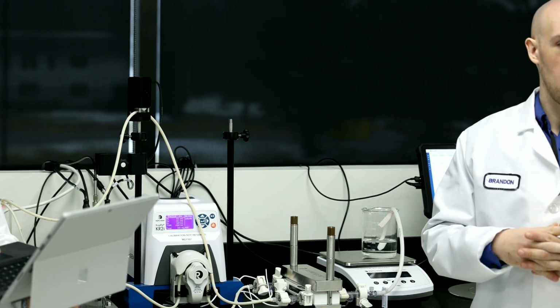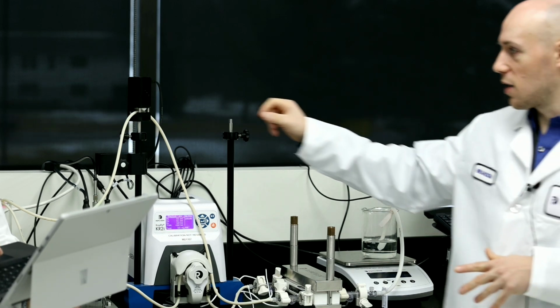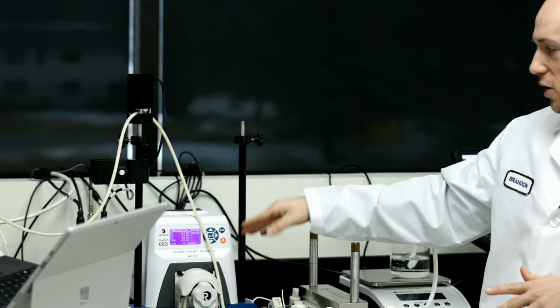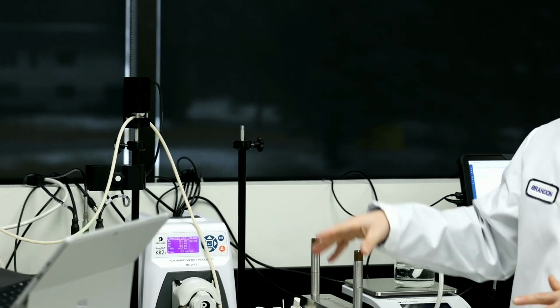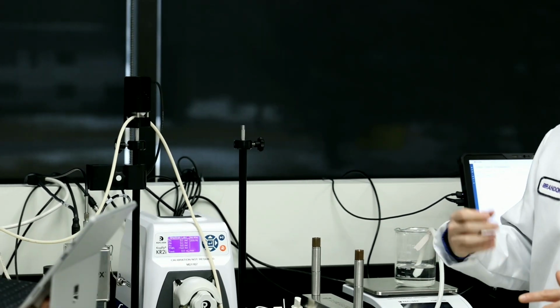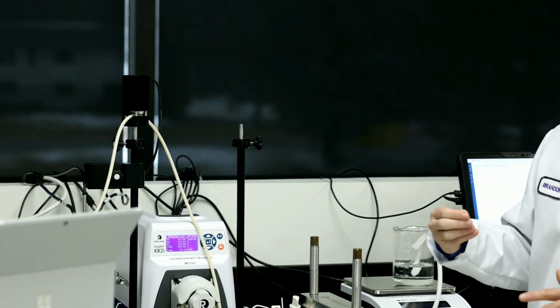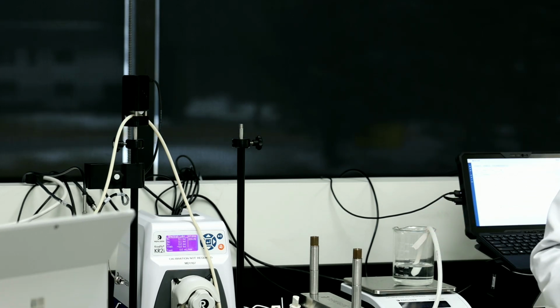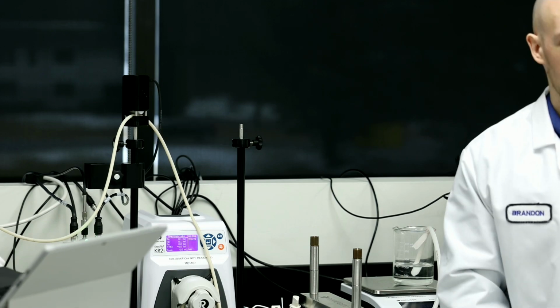Then what's going to happen is the automatic back pressure valve is going to go up all the way, releasing the tube, and your TMP is still going to hold at 10 psi because of the pressure of how concentrated the solution is. After that, the pump has an option of slowing down to keep the TMP at what you want it to be at, which is nice, depending on how high your concentration is. But that only happens with a very high concentration.